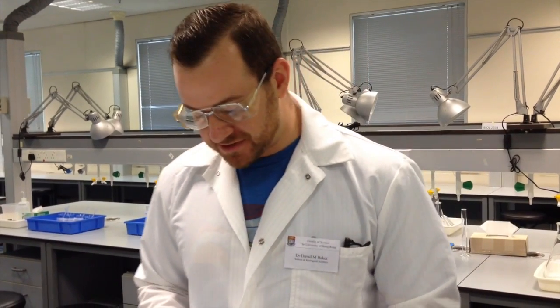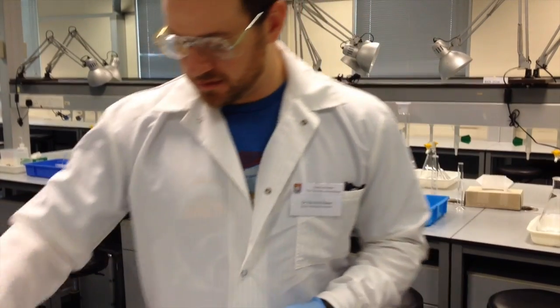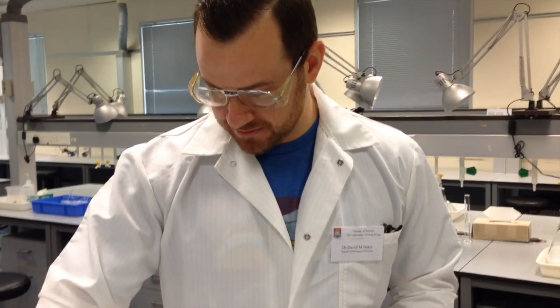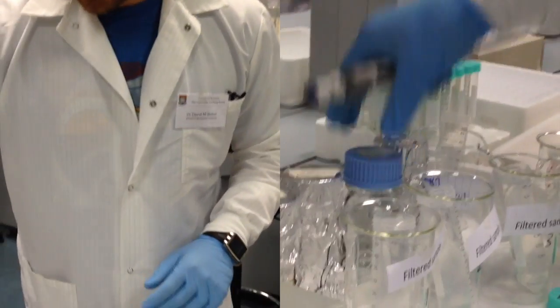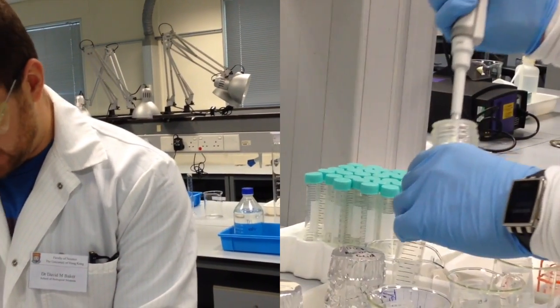Okay, so the first step is to create a combined reagent of all those chemicals, and we have labeled a beaker here for you with an empty Falcon tube, and you'll fill this Falcon tube with your combined reagent. And in an unusual twist, we're going to actually start with the sulfuric acid. So I'm going to open my Falcon tube, I'm going to get a fresh pipette tip, and I need 5 milliliters of this solution, so I'm going to have to add 5 different aliquots, 5 different single 1 milliliter additions, carefully.